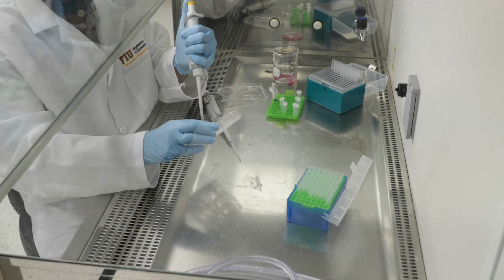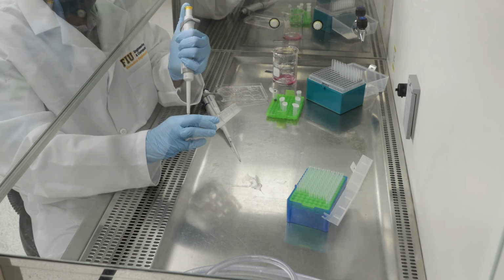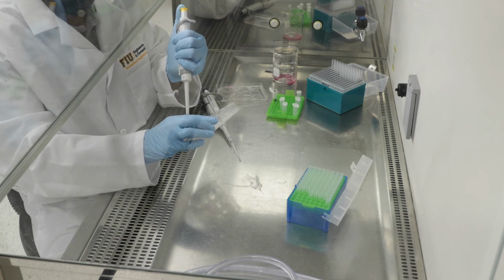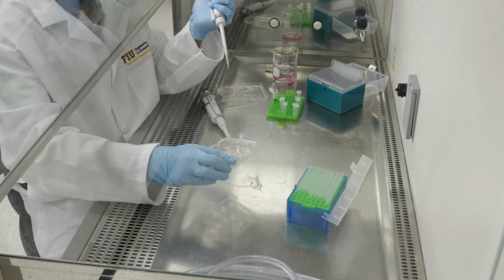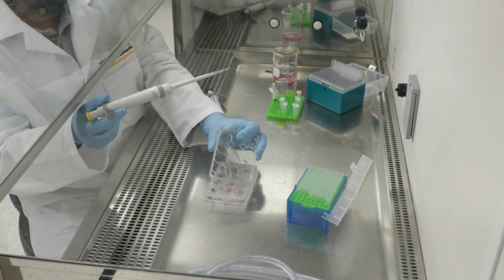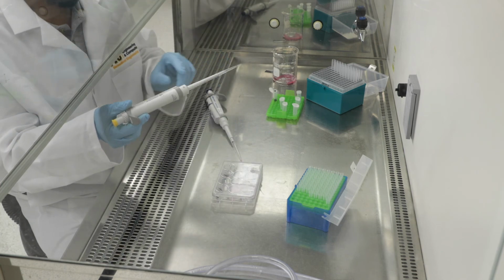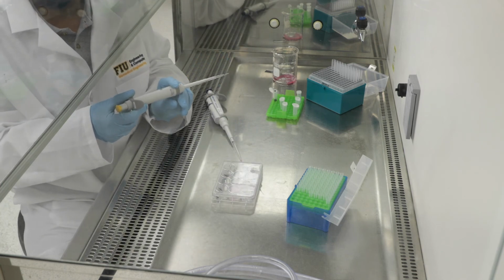Again, as you remember from session 2, here I'm mixing the trypan blue in. As you recall, the live cells have no color, but the dead cells will light up blue because they start absorbing the trypan blue dye. So then you know which cells are dead, blue cells, and live cells have no color.